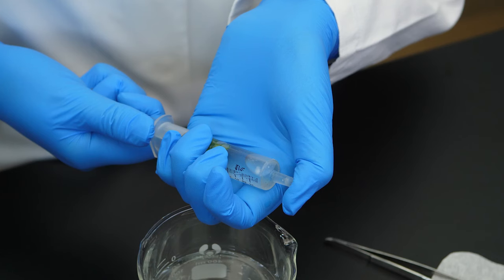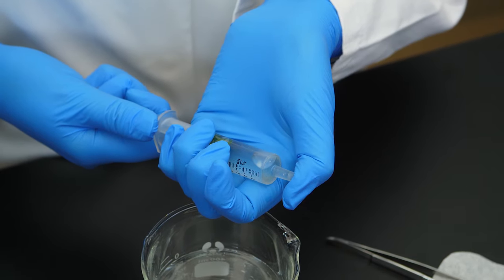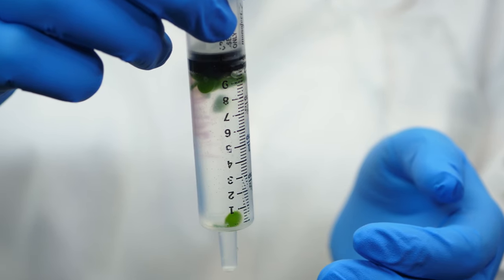Then, while still holding the tip of the syringe closed, we slowly release the plunger to its former position. Now, where are the chads?